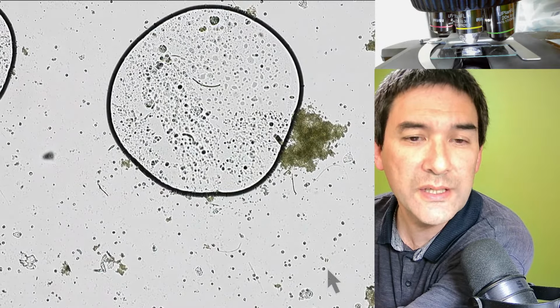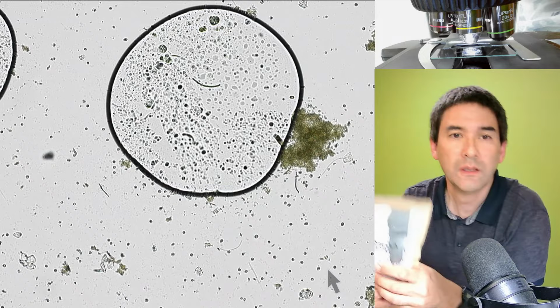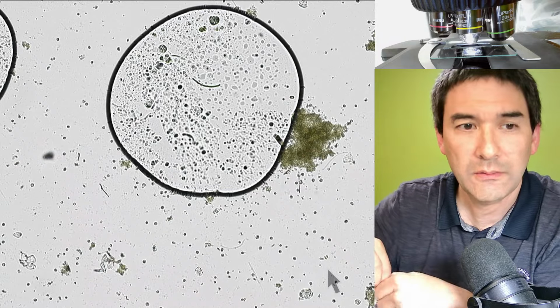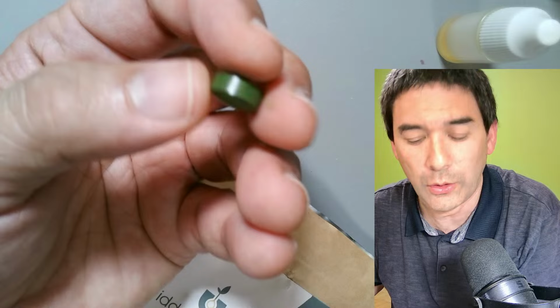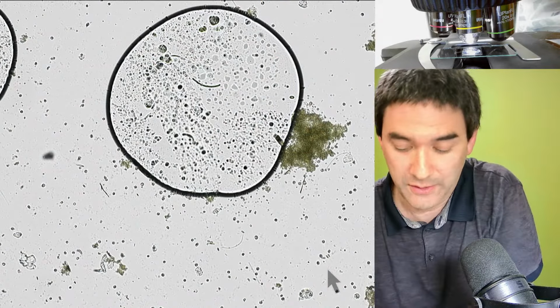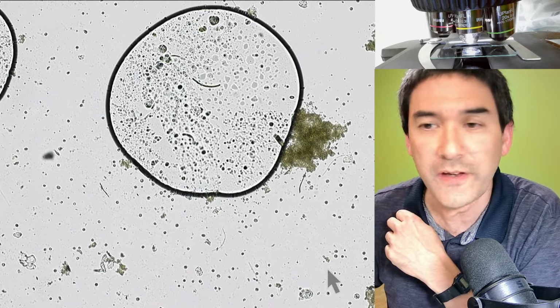And I do not understand this, because I'm going to show you now the following, just a second. Because these were the ones I used. The chlorella algae are tablets, right? These are just green tablets, and I just took one of those here, scratched a little bit off, and dissolved it in water. And I don't know, are they still alive? This is interesting that they were able to survive this whole process, because they're moving around. I don't get it. You see there are a whole bunch of air bubbles as well.